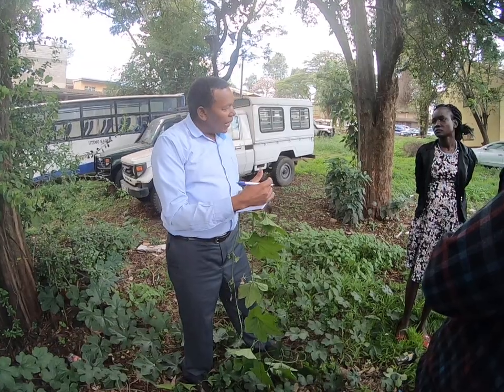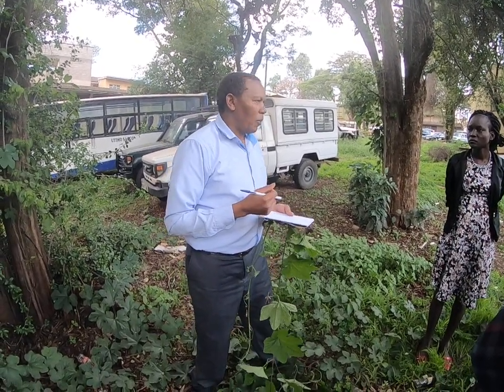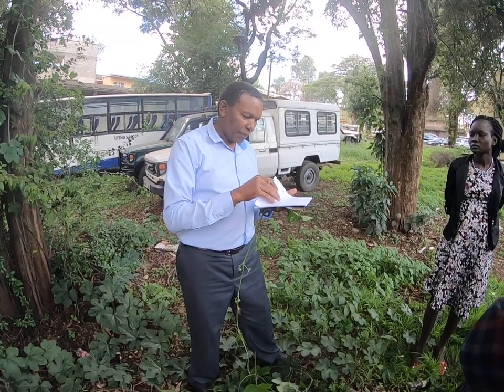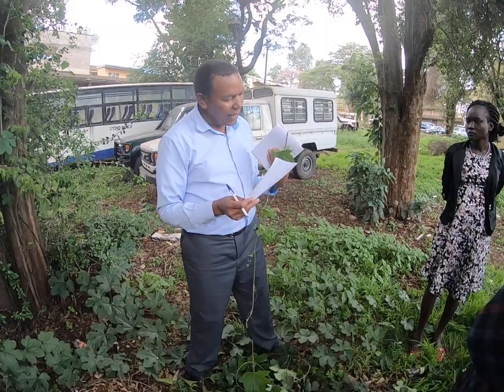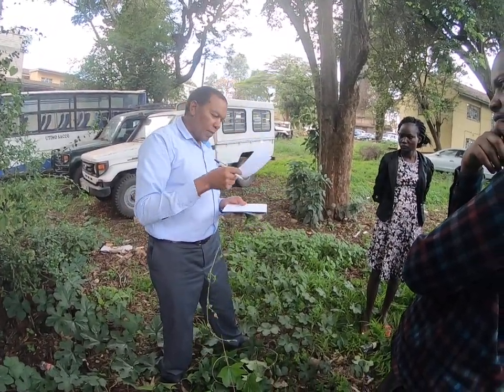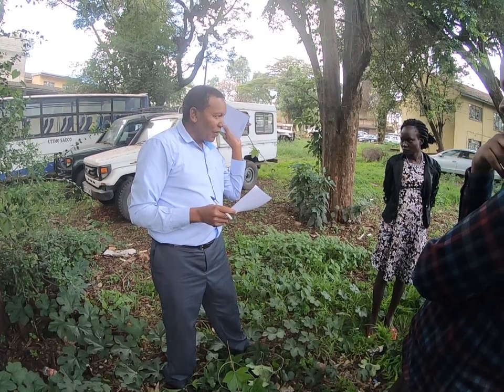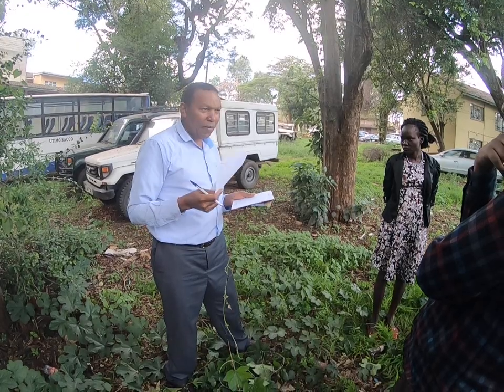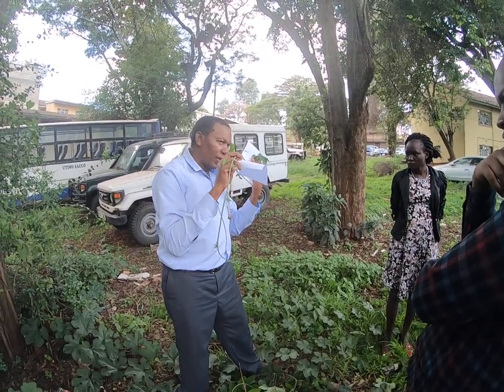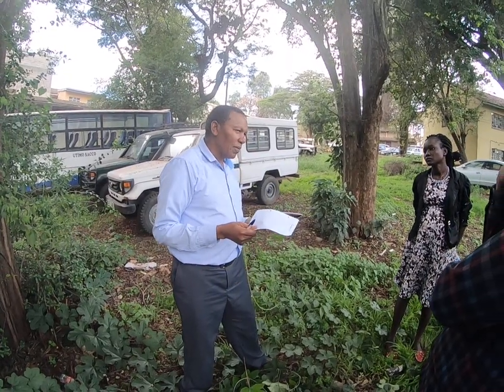Okay? So anyway, you write as much as possible, and the information you have written over here we can call a passport for the specimen you have collected. So they'll always be together. In some cases, when you are pressing the plant, you press with the paper, the one you have written. But it's also good to have your notes with you. For me, I prefer this way. I prefer writing the notes here, but giving this a code, and just having the code on the paper there, and then retaining the notes in my notebook. You get it, eh?